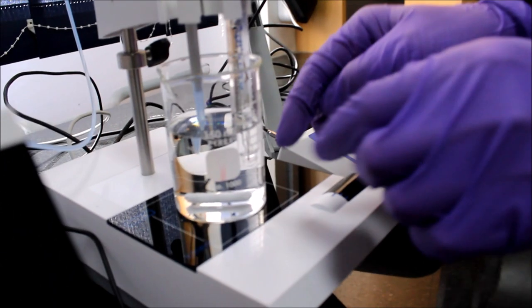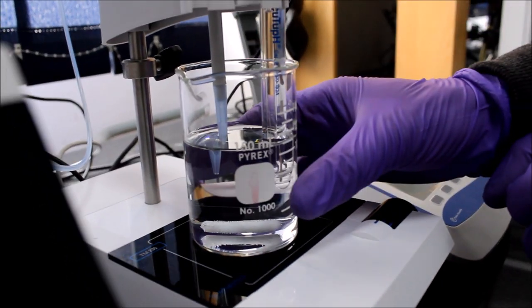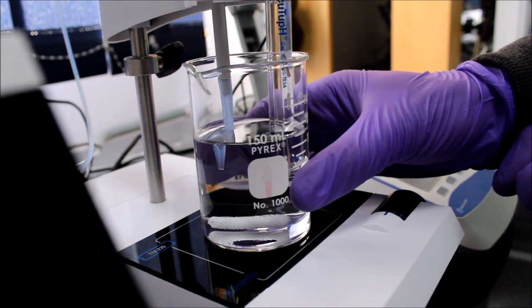Ideally both the dispenser tip and pH meter probe should be kept somewhere in the middle, but not too deep since it will touch the magnetic stir bar.